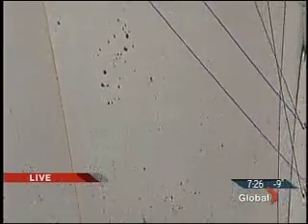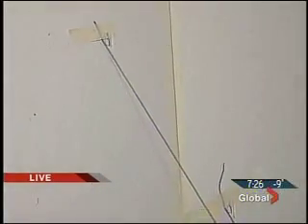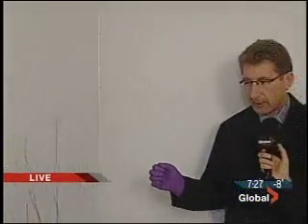And then how is it that you managed to bring them all to this one point? I take individual stains, and with that stain, I measure it using calipers or through digital photography and a computer program. But in this case, I use calipers. I measured the stain, and through basic trigonometry functions, I was able to determine an impact angle.